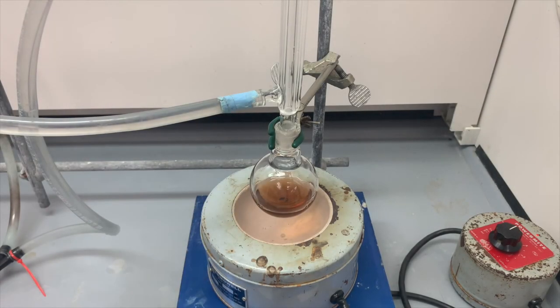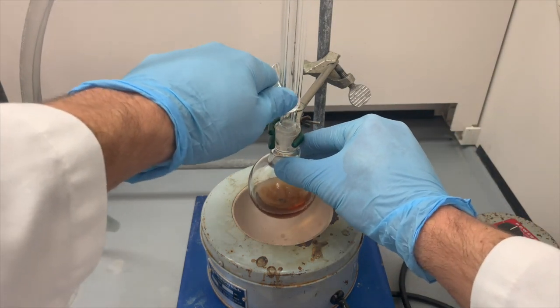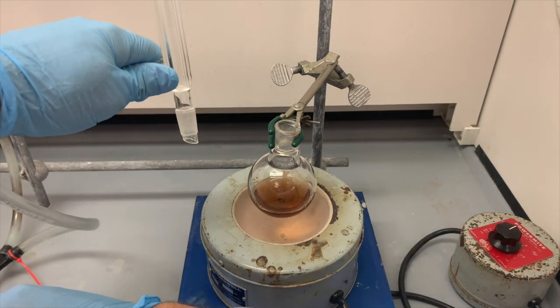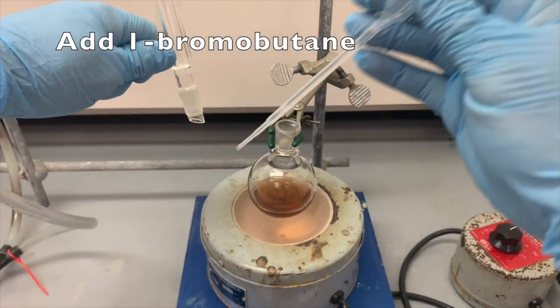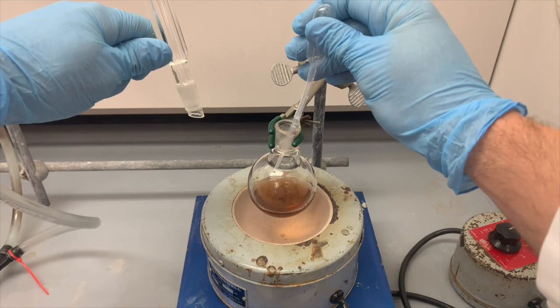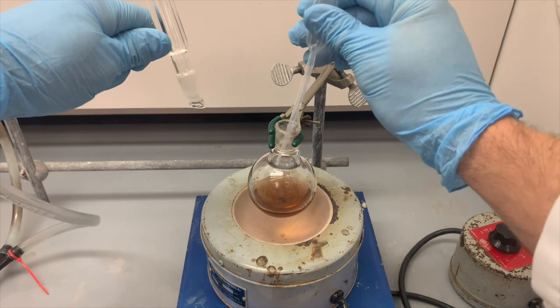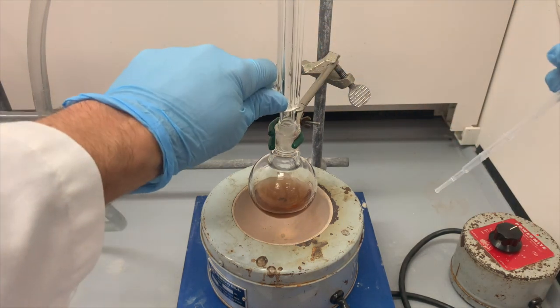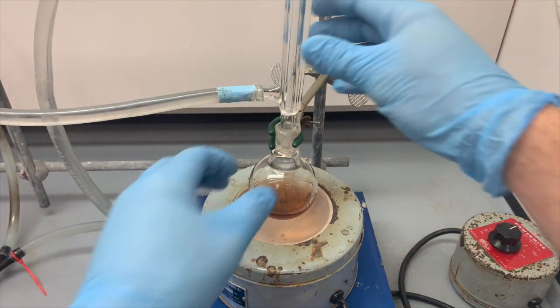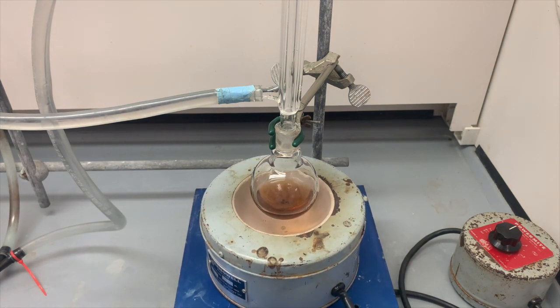Okay, at this point, the boiling has subsided, so we may now remove the condenser from the top of the flask. Just kind of set that off to the side. And right here we have 1.0 milliliters of 1-bromobutane. So the 1-bromobutane is our substrate in the SN2 reaction, and the naphthoxide that we have just generated is going to be our nucleophile. So now we are ready to heat this back up by lifting the jack.